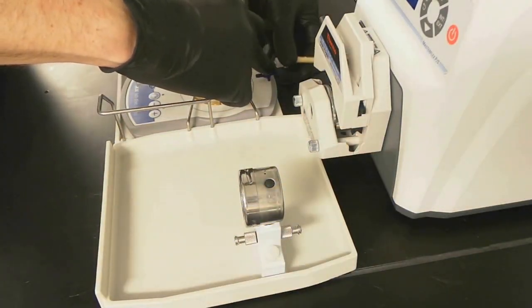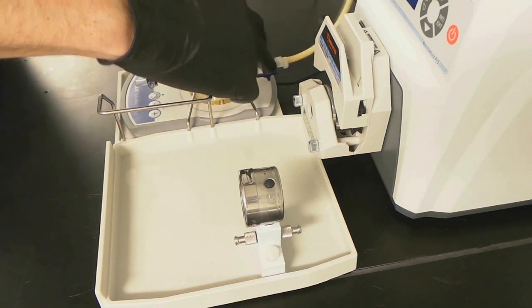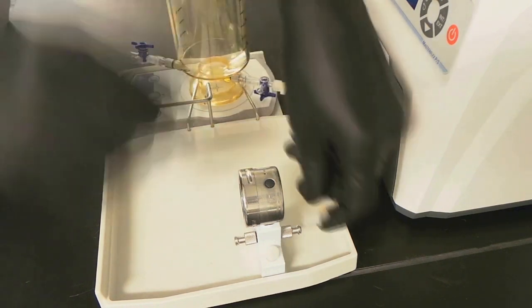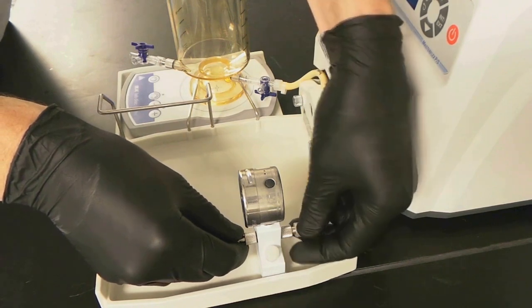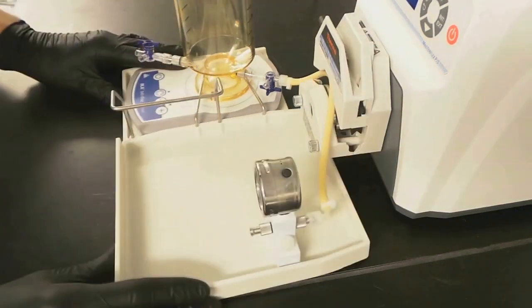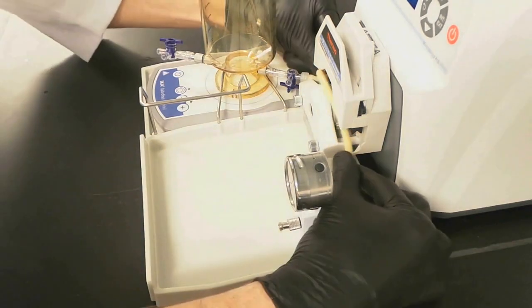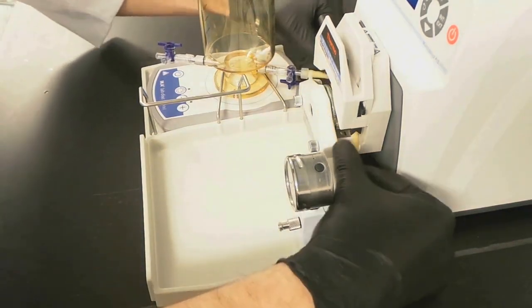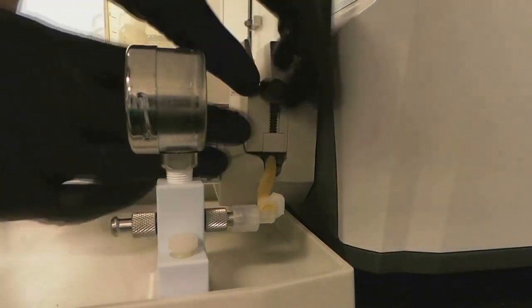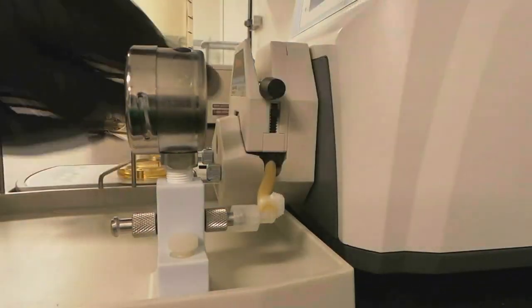Guide the tubing into the pump head. Make sure the tubing is aligned correctly before engaging the pump head, and go to each side of the pump head and press down on the teeth to help keep the tubing in place.